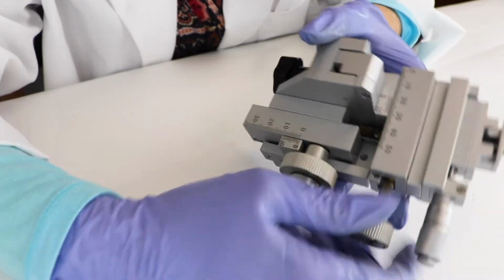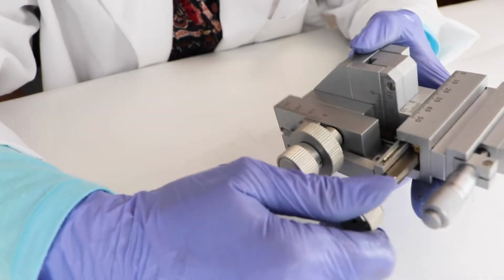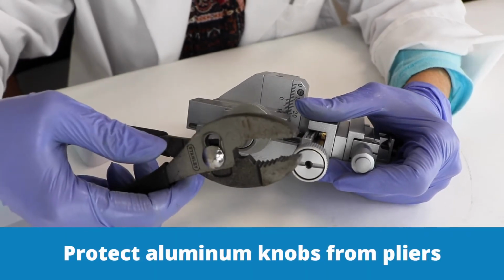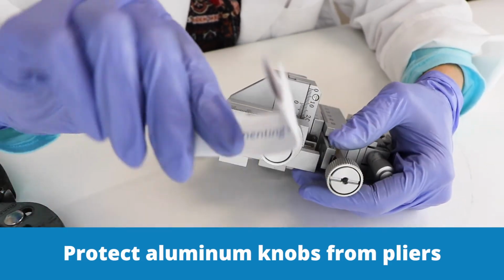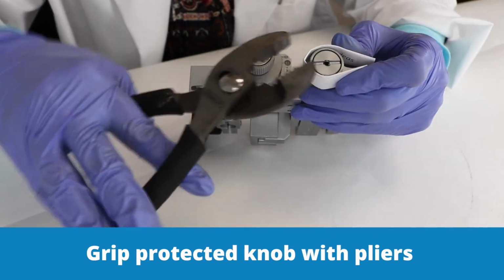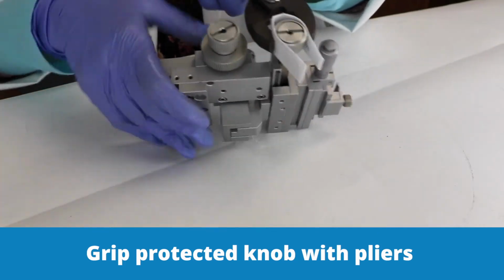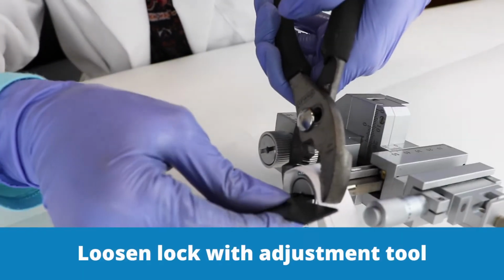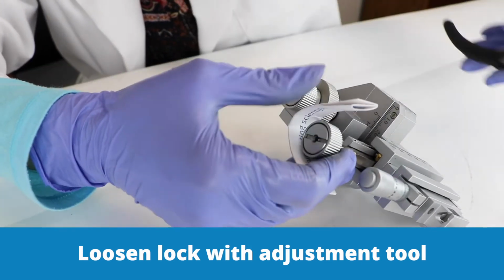And the first thing you do is drive it all the way out so that you get a little more room in here to work. These are aluminum, and if you put a pair of pliers on it directly, you're going to scratch it all up. So to keep it looking nice, we're going to wrap it in just a folded piece of paper. If I put the paper around there and wrap it, then I can hold it with a pair of pliers while I put my adjustment knob in there and loosen it up. Then I'll pull this off.